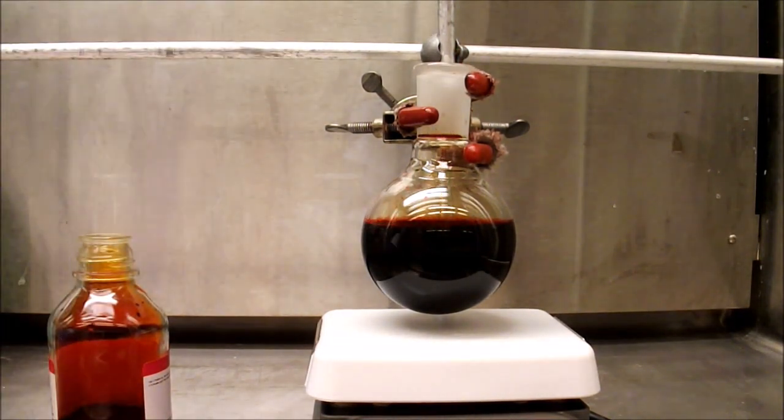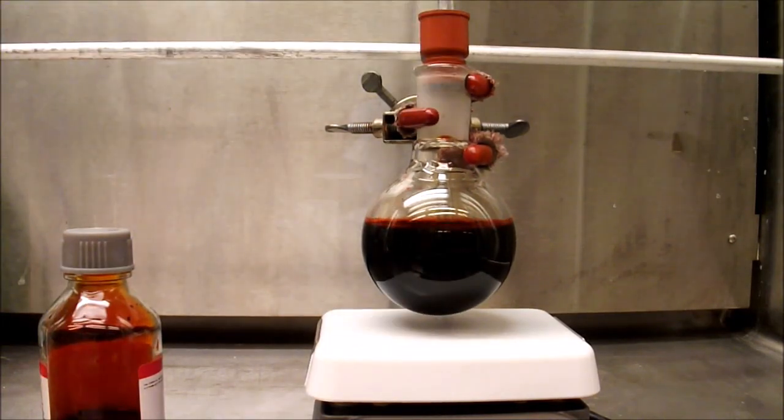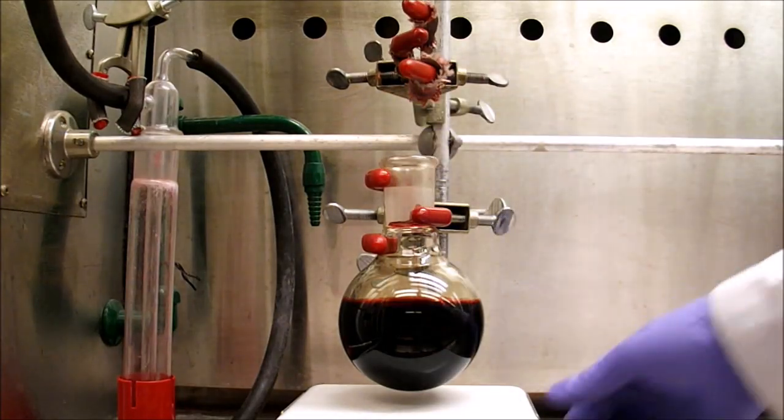This reaction can be monitored by TLC plates run in DCM. Fortunately, since this reaction does not form any other products or undergo multiple brominations, careful watching is not necessary.